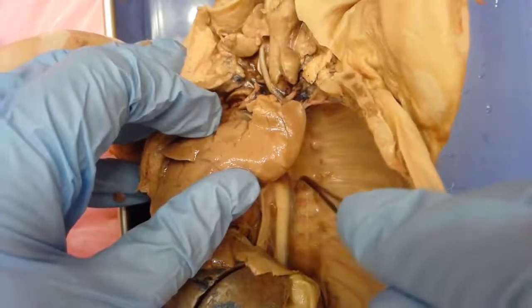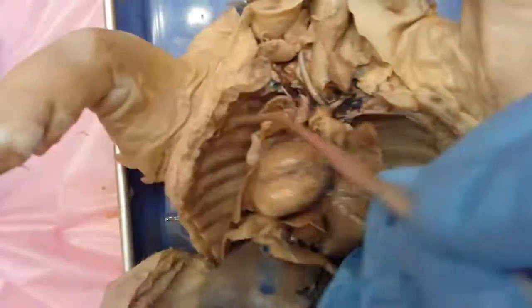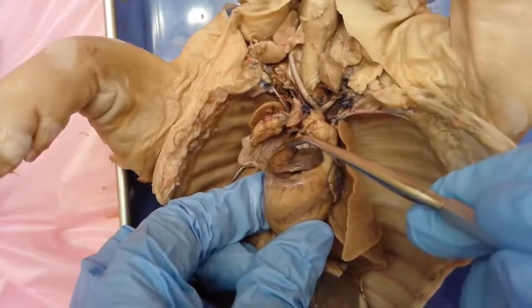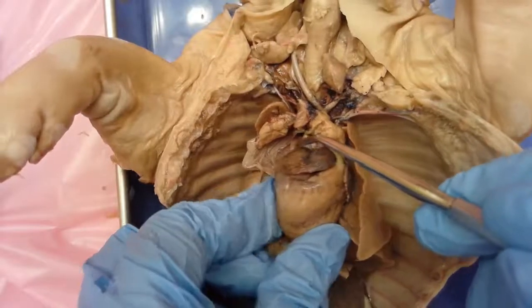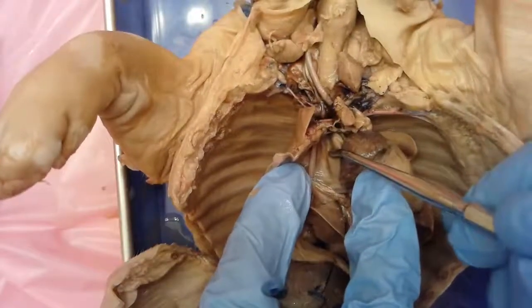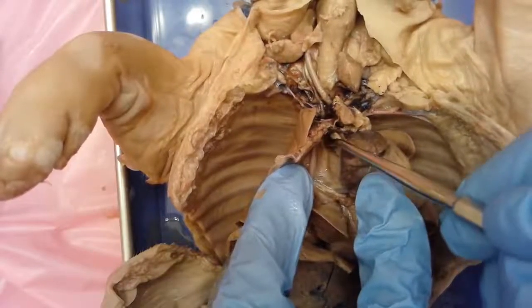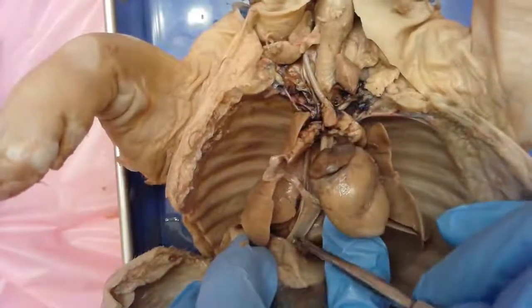That descending aorta comes all the way down and it delivers blood to the lower part of the body. To review the pathway that blood takes: blood has to enter into the right atrium from these two branches of a huge vein called the vena cava. Here is actually the vena cava that comes from the upper body — this is the anterior vena cava. And in humans, we call it the superior vena cava, so that direction is a little bit different because you walk upright.